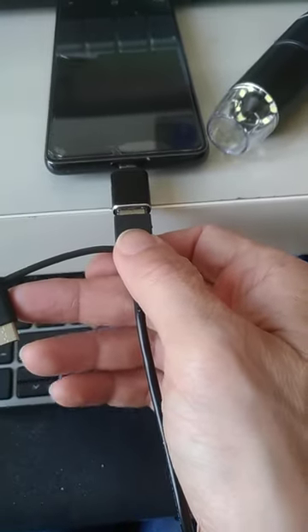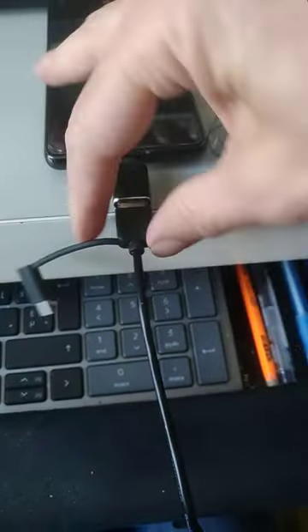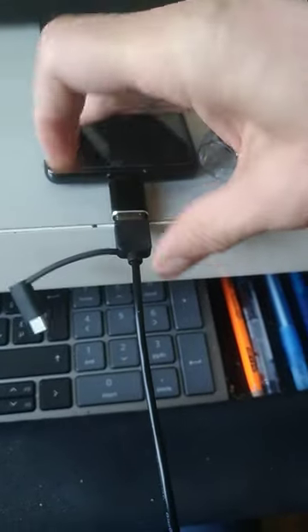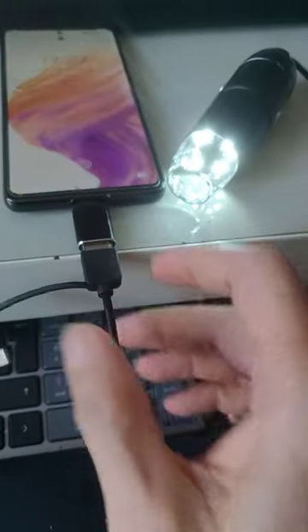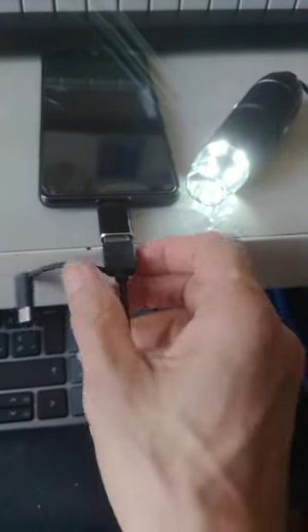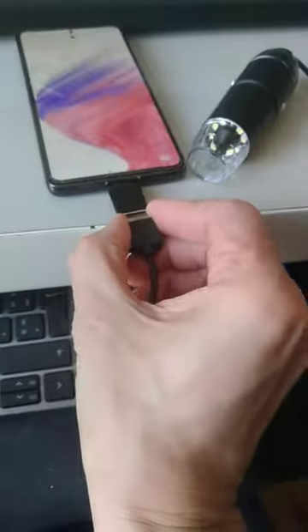And here you'll see it comes on as well. It's a little tricky to do with one hand. Now there we go. Okay, so you see that way with the regular USB and an OTG adapter. Sorry, but it's a little tricky to do this with one hand.